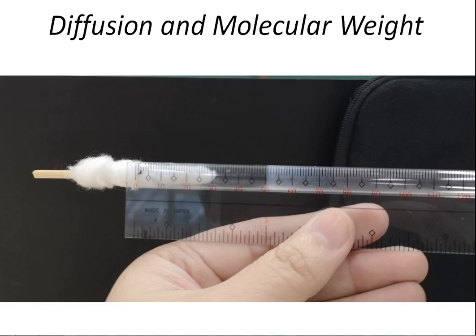Based on our results, what can you say about the molecular weight of the two reagents in relation to the distance traveled? Since we have distance over time, that would be the rate of diffusion. So what is the relationship of the rate of diffusion to the molecular weight of our reagent?